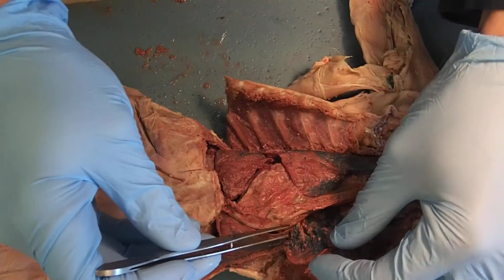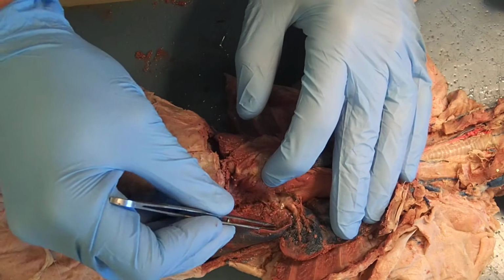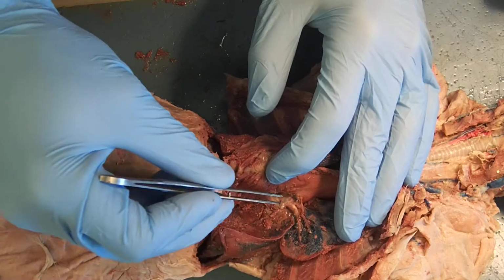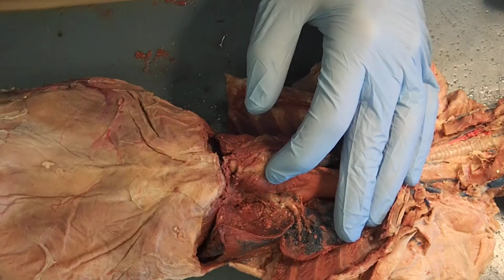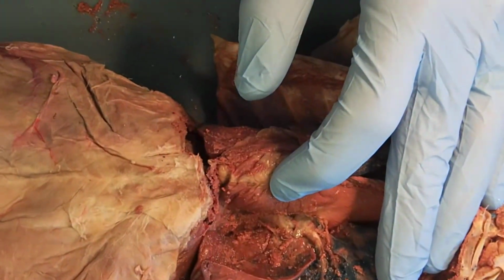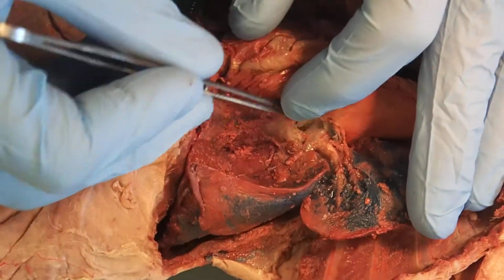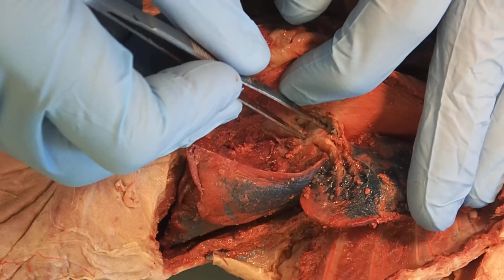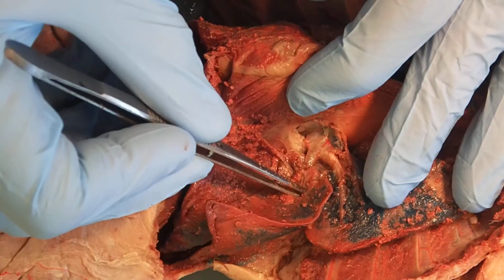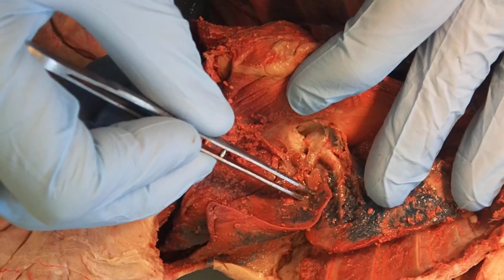If we were to fold one of these back, what we're going to see, and I've already started picking at this a little bit, is that this trachea, as it comes down towards this region here, is going to start to branch off into different sections. And let's zoom in on this. The first big branch that we would have would be our primary bronchi. Then the primary bronchi, which is all the way back here, will branch again. You see a branch here, here's a branch here. These are now the secondary bronchi.